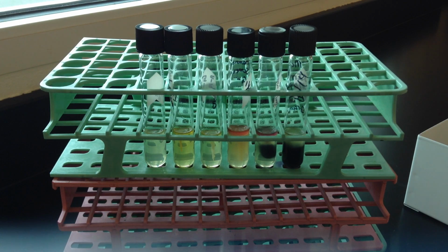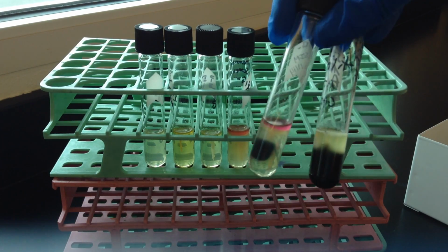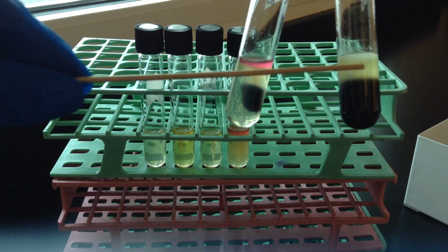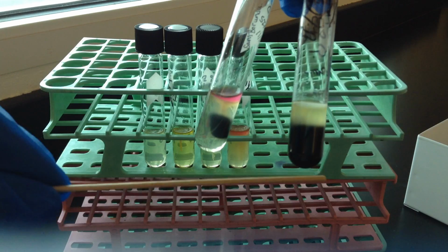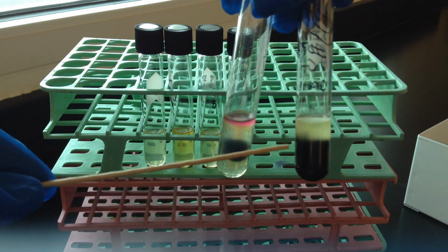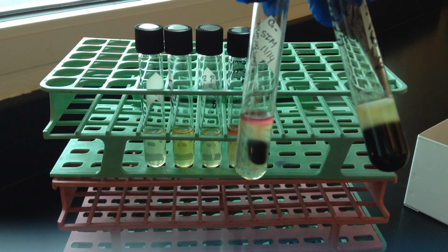So for sulfur production, just like in the TSI tube, the two enzymes that can contribute to that are cysteine desulfhydrase or thiosulfate reductase. And again, you're detecting an H2S end product. And that's going to be indicated by black here in the butt. I just have a couple of examples here so you can see that the black can really just take over the butt depending on how much the organism grows, and again, we associate that black with motility, so it moves to all sides. Or you may have a little bit less black, and you can have even less than that there.